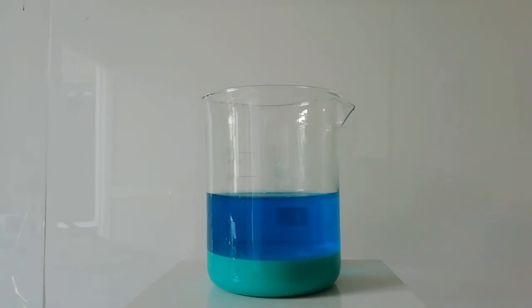Now we need to filter this mixture and dry the copper citrate.